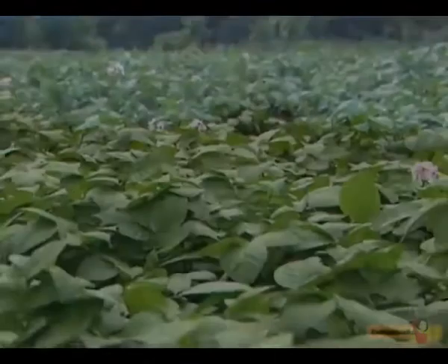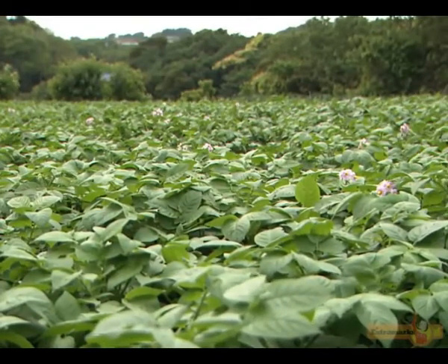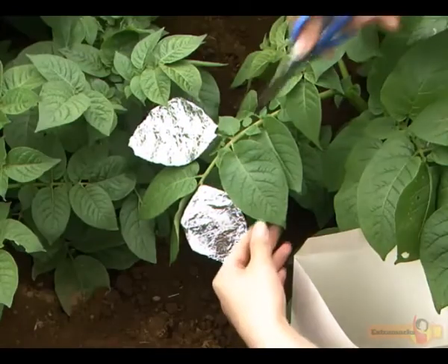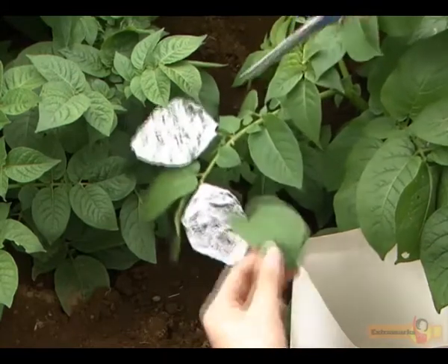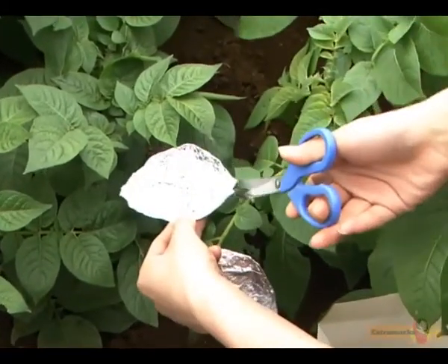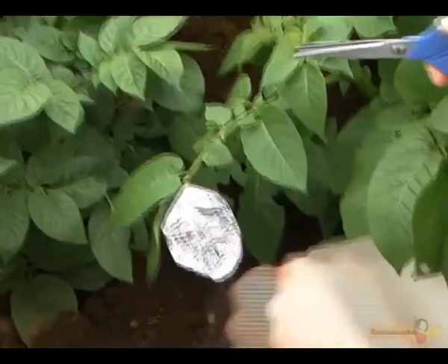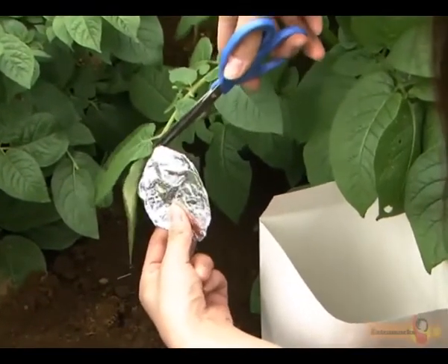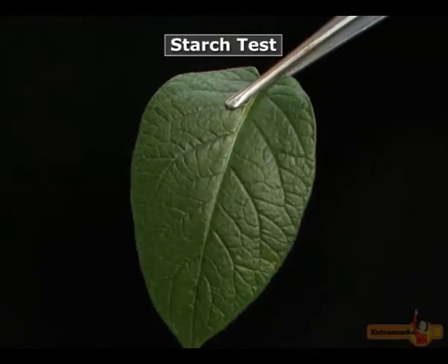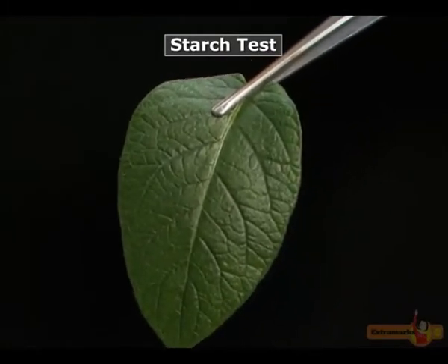The plant is then exposed to light for a few days. A few uncovered exposed leaves and leaves that were covered with foil are then detached from the plant. The starch test is then performed on the detached leaves to examine the presence of starch.